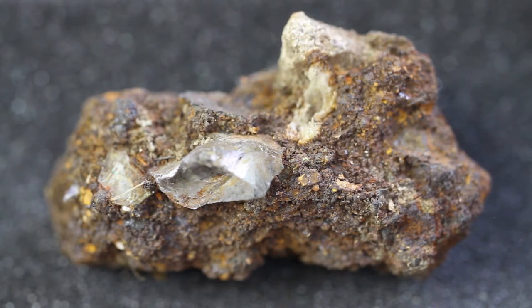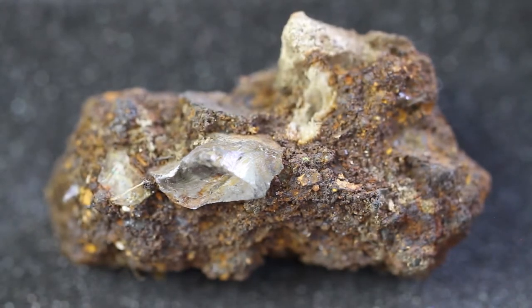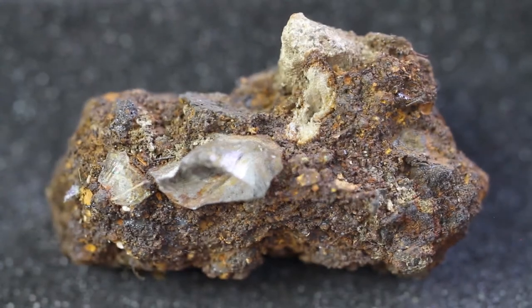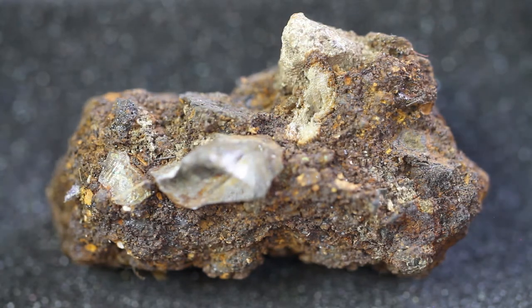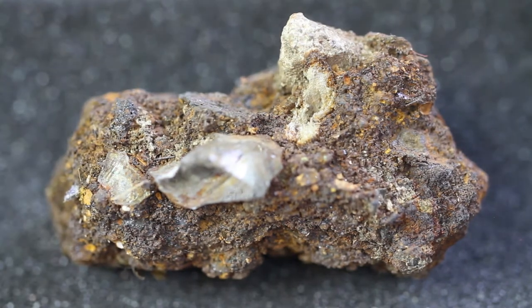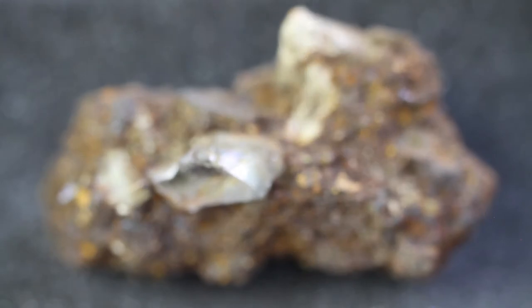I'm just going to do some focus pulling here so you can see the tip there of the glass-like inclusion. Go down onto the body and through to the rim. And then just change the lighting slightly so that you can see some of the reflection shapes there, and also to the glass inclusion. I'll have a look around it.